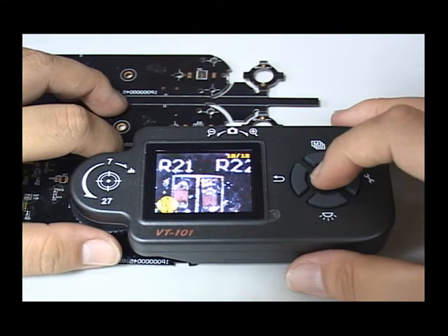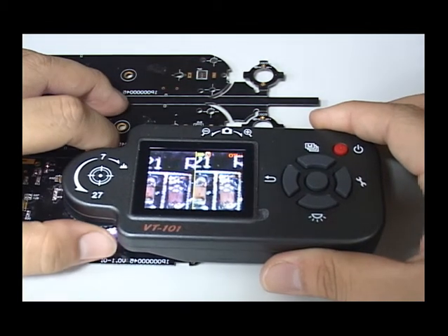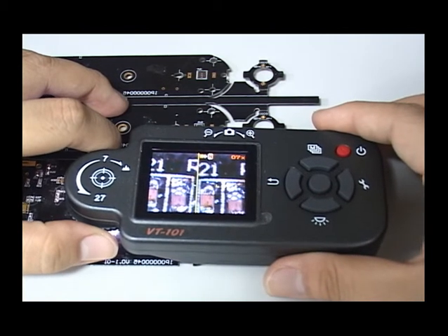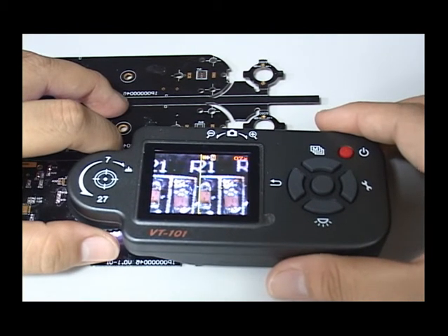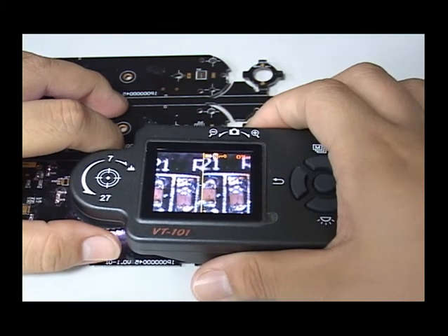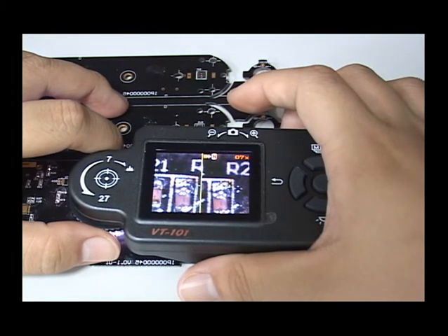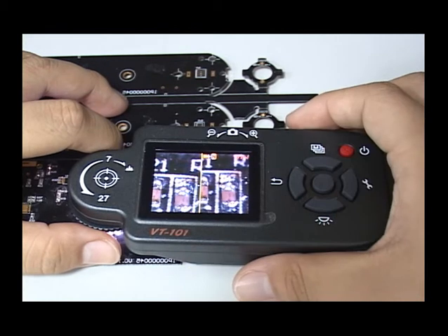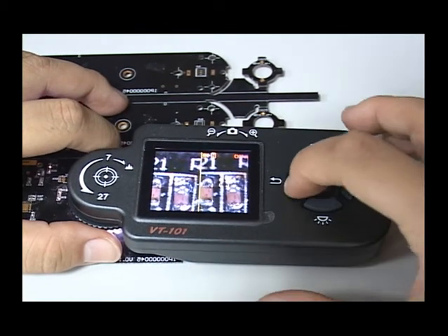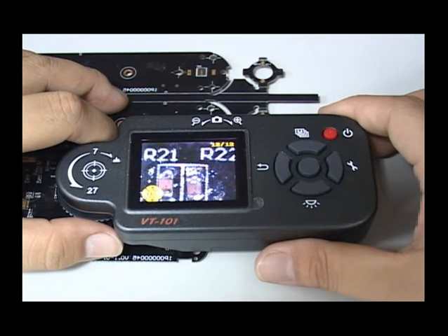When previewing a photo, press the middle button to enter compare mode. It lets you compare the saved photo with the currently observed object. When comparing, you can press the capture button to pause the preview video, and click again to resume. When you want to finish compare mode, press the left button to go back to viewing the photo.